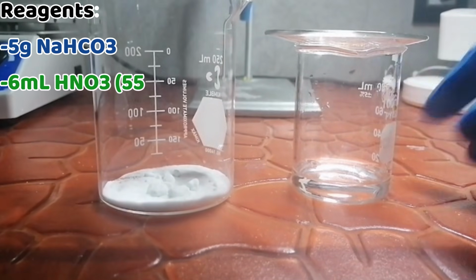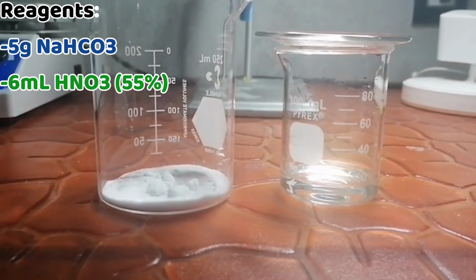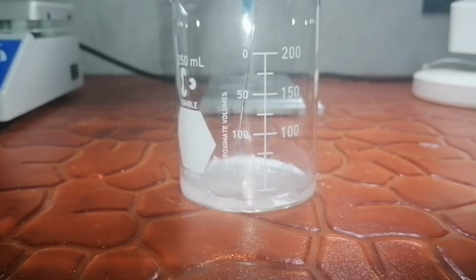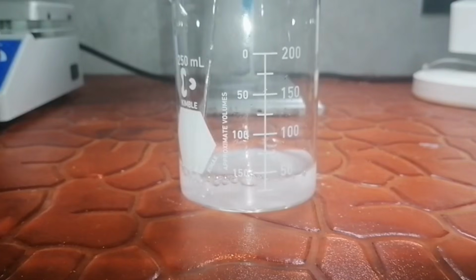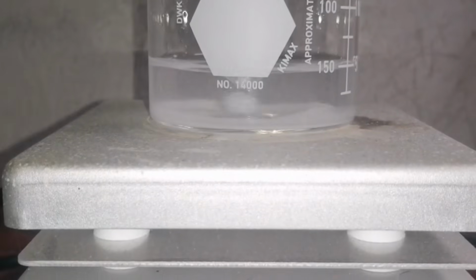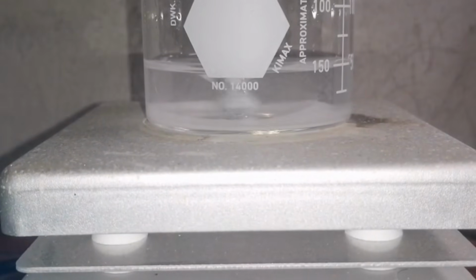We just need 5 grams of sodium bicarbonate and 6 milliliters of 55% nitric acid. The first step is to pour 40 milliliters of distilled water into a beaker containing our sodium bicarbonate. Our initial goal is to completely dissolve the bicarbonate in the water. To speed this process up, we can place the beaker on a hot plate and stir it.